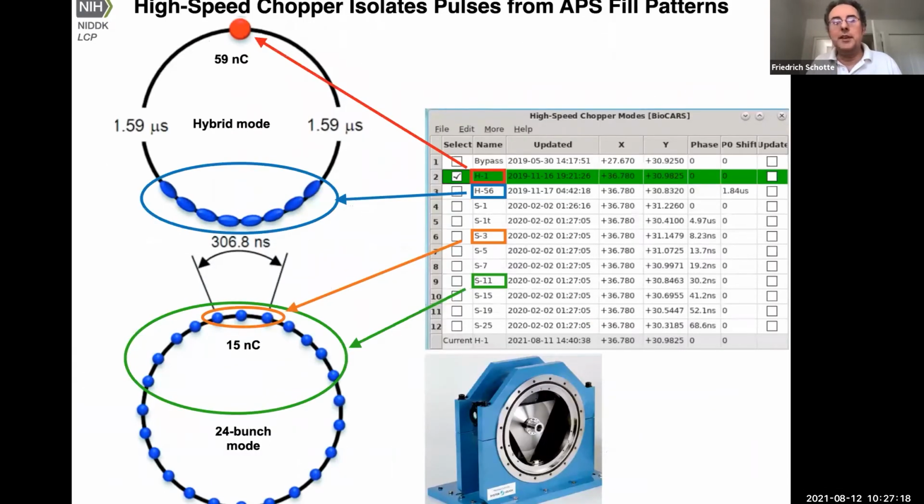So that brings me to this second part of my talk, which is about the software to operate the beamline. I spent a lot of time generating these configuration tables, which control equipment in the beamline. So for example, there is one to configure the chopper. So what I talked about is this phase control here. So there's like a chopper phase and a phase shift. So for the different modes of operation.